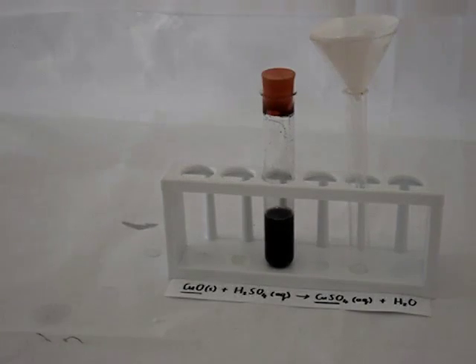Filtering means that we pass the solution through a funnel which has filter paper in it. You can see that over here.